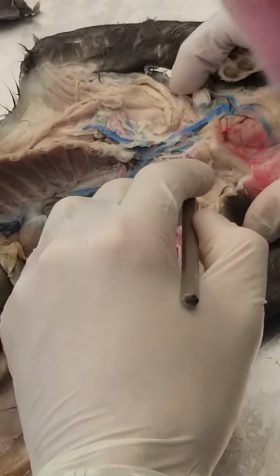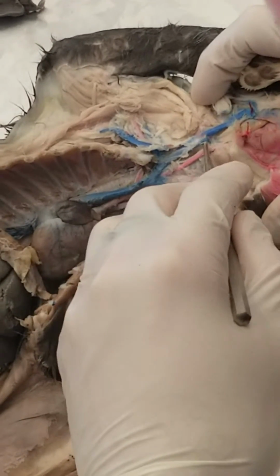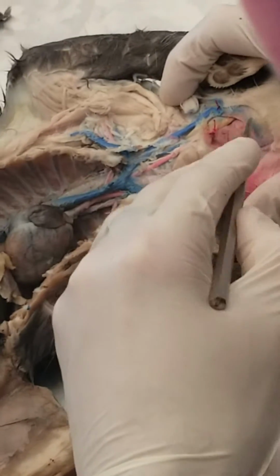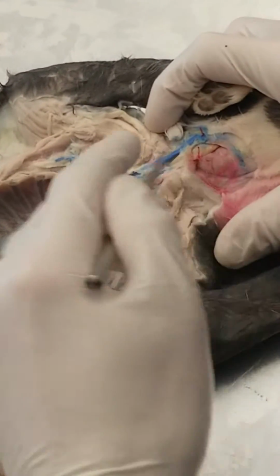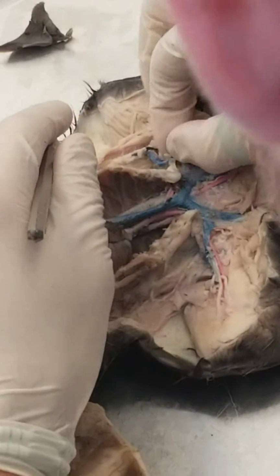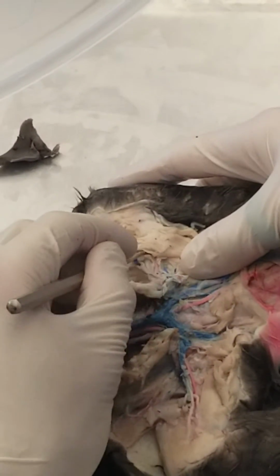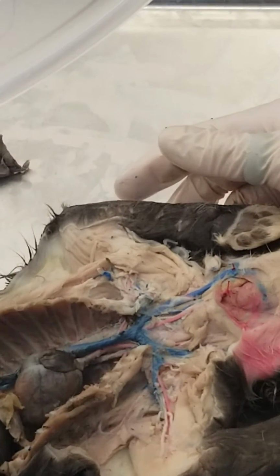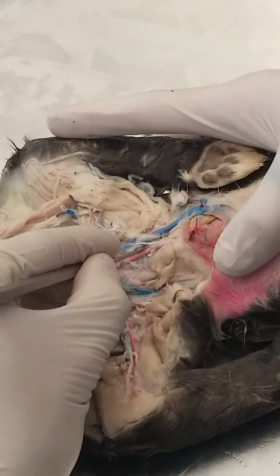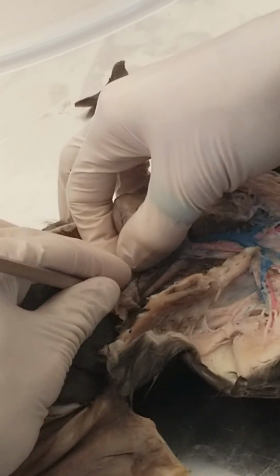Also, if you follow both jugulars up, so here's your external jugular, here's your internal jugular. It's rare to actually be able to see this as well in the cat. Right? External, internal. The externals loop up here below the chin at the transverse jugular. And then again, here, this is actually the brachial vein down here. Okay? Your brachial will be farther in there. Alright? And then along your carotid, there's your vagus nerve and a phrenic nerve. See that? Going along near the esophagus?